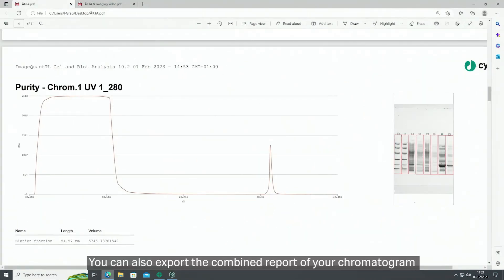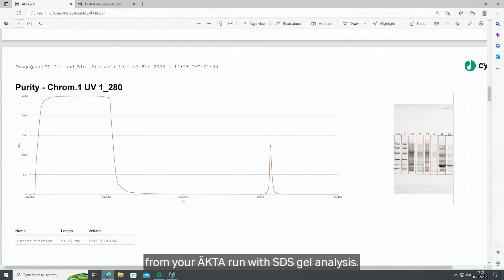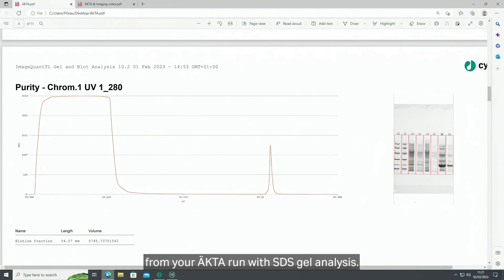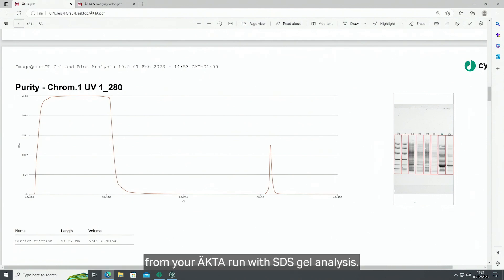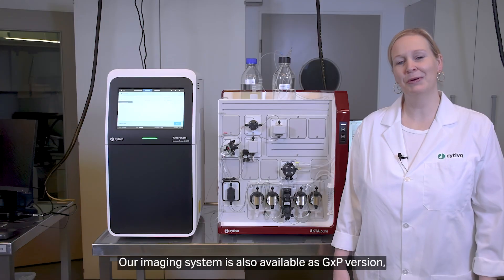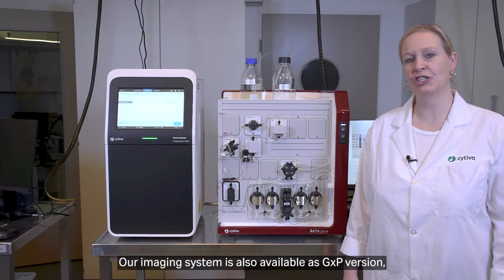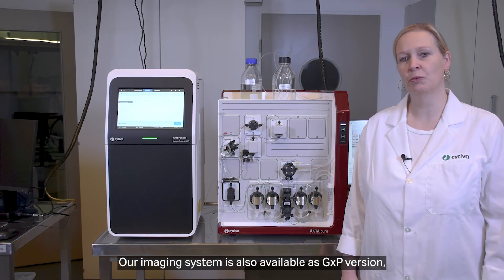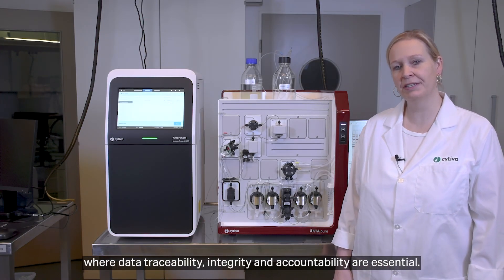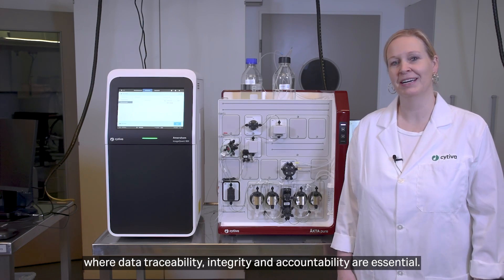You can also export the combined report of your chromatogram from your ÄKTA run with SDS gel analysis. Our imaging system is also available as a GXP version, where data traceability, integrity, and accountability are essential.